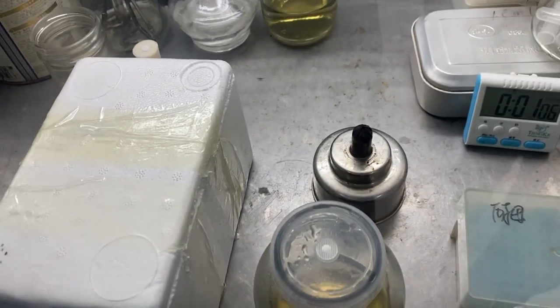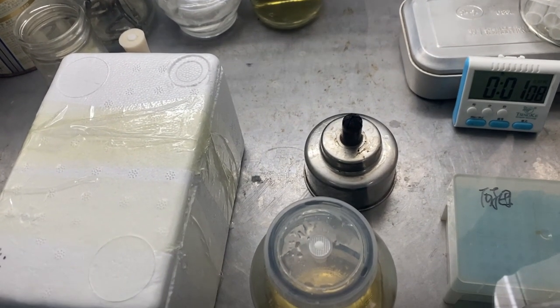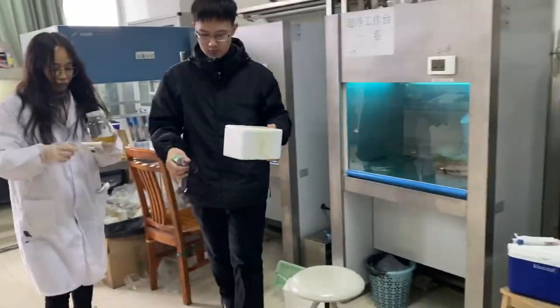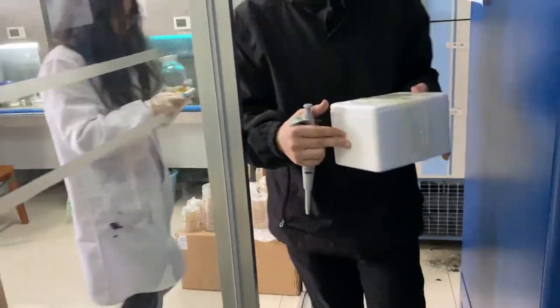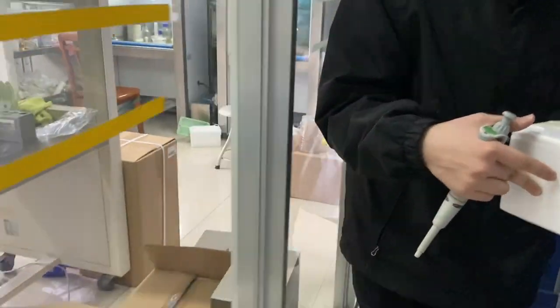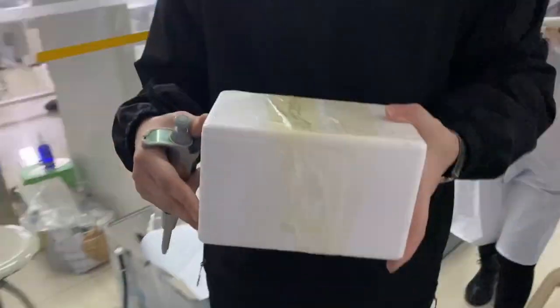Similarly to the AD vector, the BD vector should be sealed tightly after transferring the media, given an extra layer of sealing, and then placed under sterile conditions for 40 minutes.